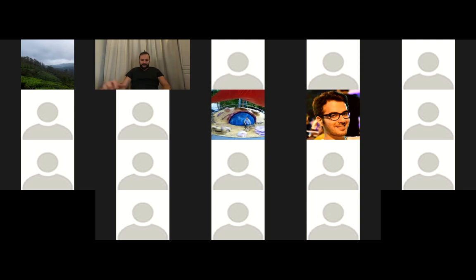Alper, we have just one question from Kashi. He asks how we can look for the gene names on the heat map for their exact locations. That is not easy to do, because these are not interactive. That's why what I created is the browser.